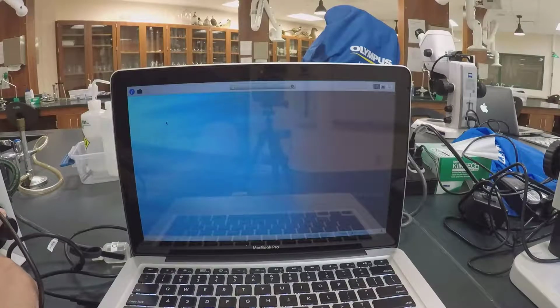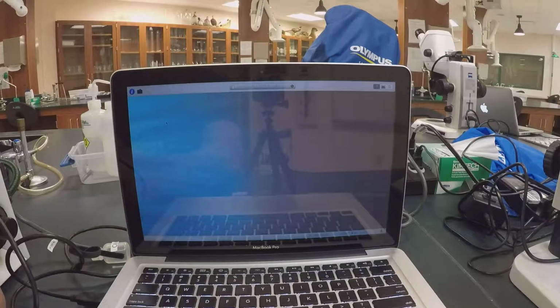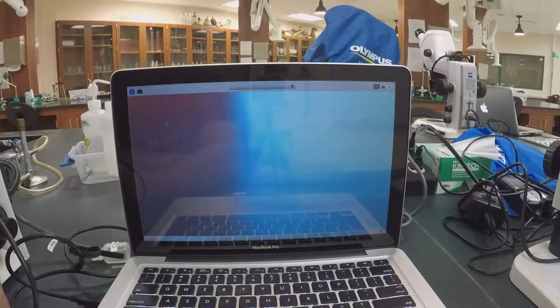And there you can see the blue thread. It's in focus, but when I have it in the center, it just looks like a big black spot. You can't focus on anything. You can't focus on the top or the middle or the bottom. You have to move it to the outer edge. And you'll see that that's important to know also, that if the thing that you're trying to look at under the microscope is thick, then you won't be able to focus at all. So you'll have to go to the outer edges where it's much thinner to get a focus point.